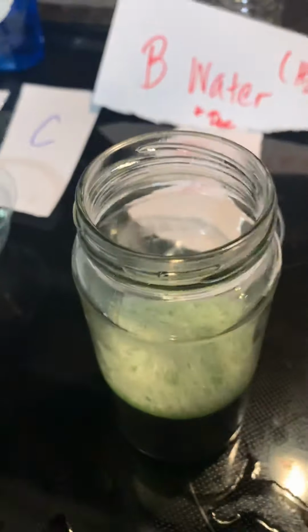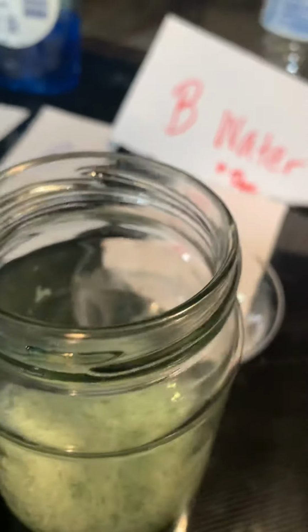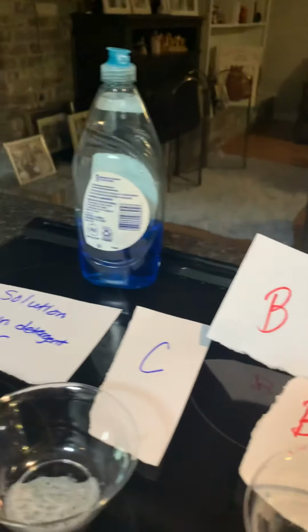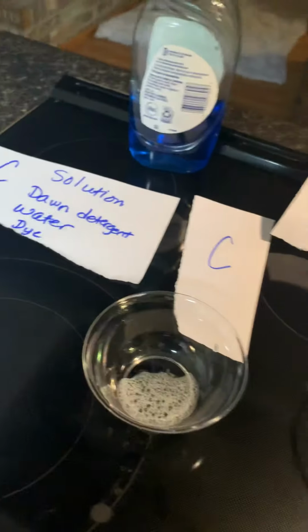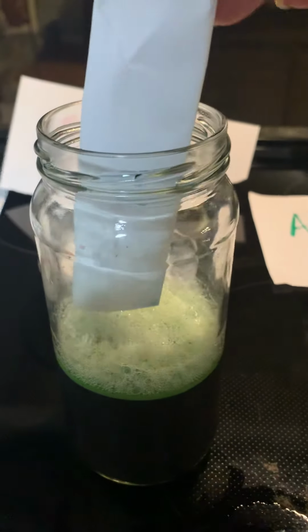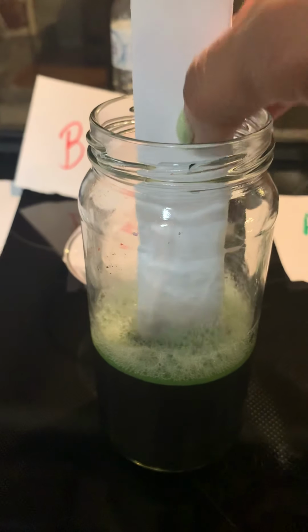And I'm going to take a little paper here and let us stick it down and see what we get when we go through all layers. Okay, we're going to fold it in half a little bit. Give me a minute here. And this is just an afterthought to further conclude. And the paper has passed through all layers.